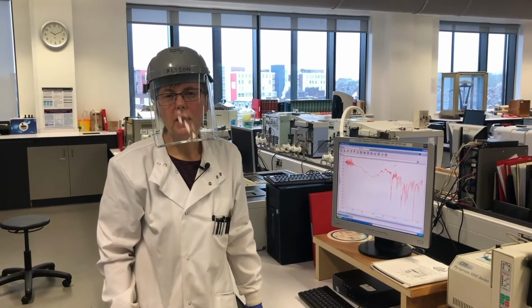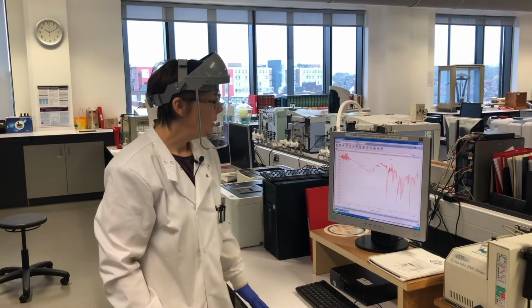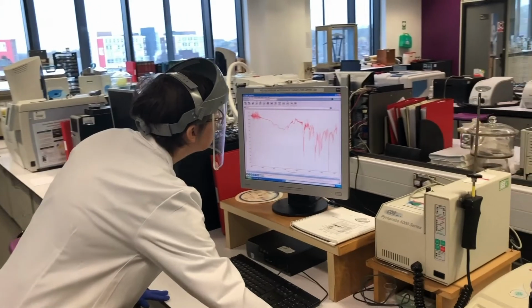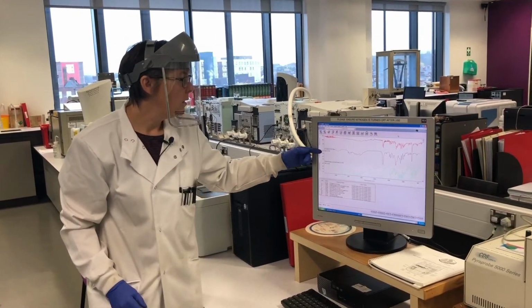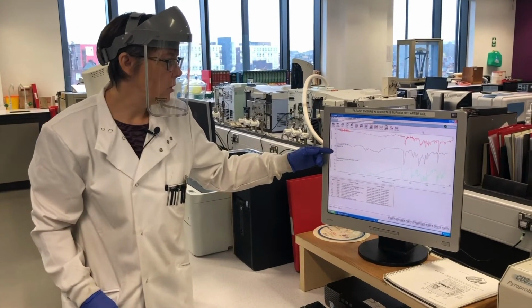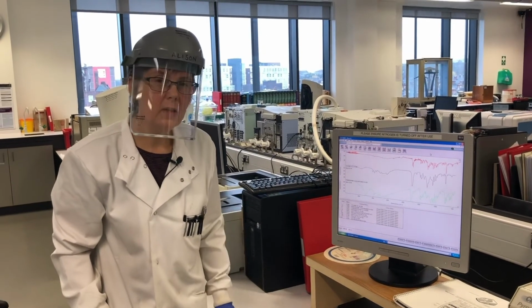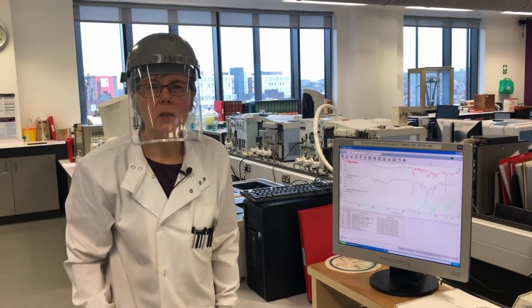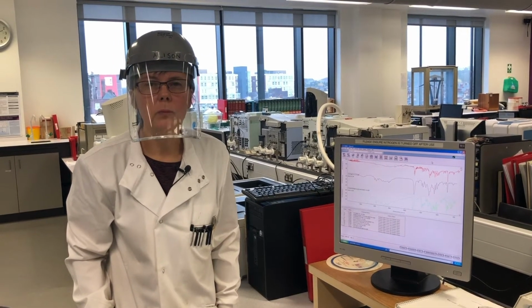Once the spectrum has been collected, one of the great things about FTIR is that you can search against a library. And here we can see that the library has matched our unknown powder to cocaine, 61%. It's not a great match, so it might not be pure cocaine. We need to use another technique to further analyse our powder sample.